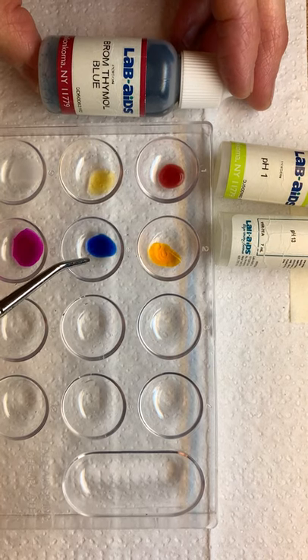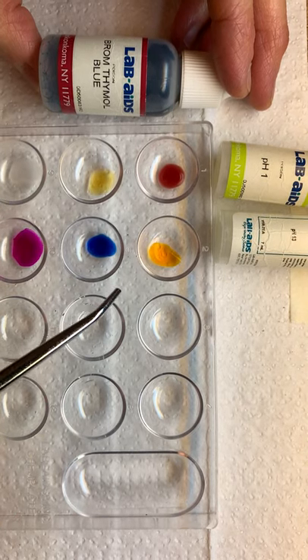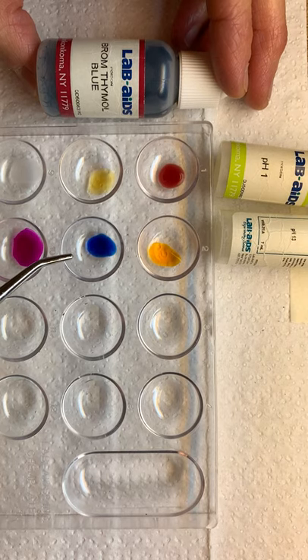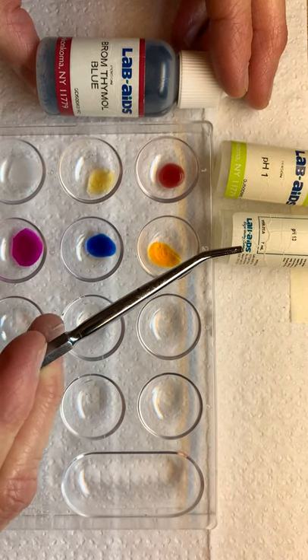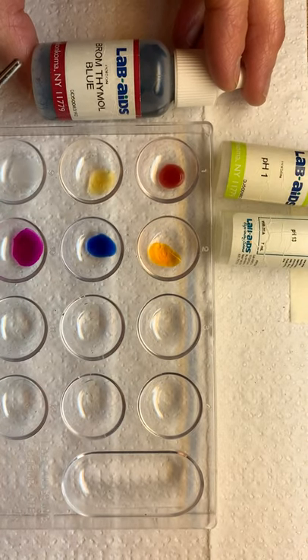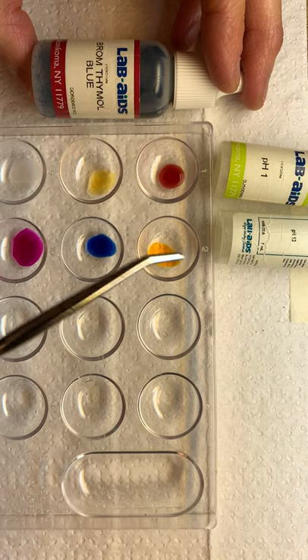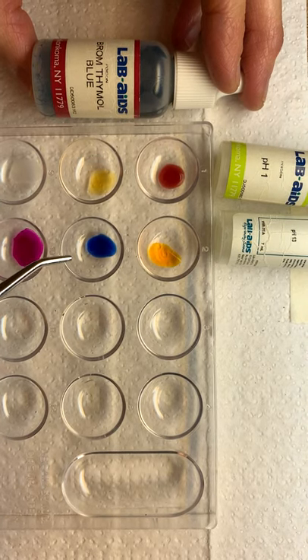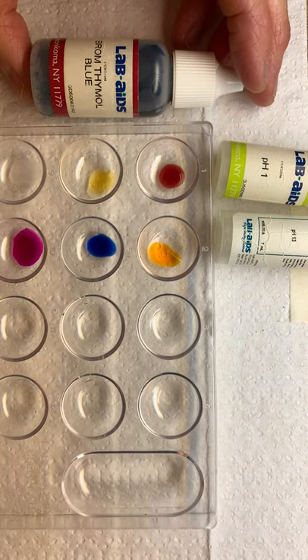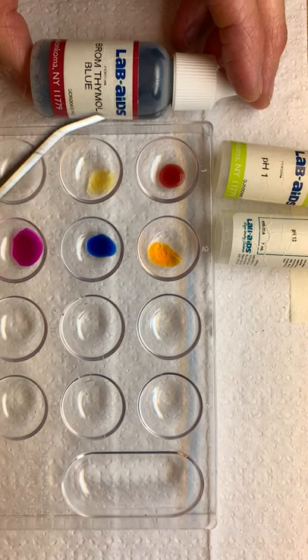Let's look at bromthymol blue in the presence of pH 13 — question number six. Bromthymol blue changed to what color in the presence of pH 13? You know pH 13 is a base, and bromthymol started out blue and it's still blue. So bromthymol had no change in the presence of pH 13, which is a base. It did have a change in the presence of an acid, pH 1.